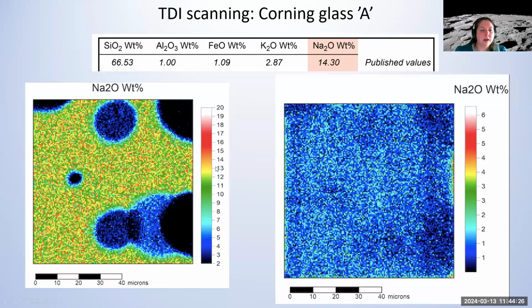And again, just to show, if I look at the last map for sodium, the last one here on the right-hand side, compared to what I get with the TDI scanning, this is after half a second of mapping that each pixel experienced. And you can see that almost all of the sodium is gone, and the previous spots seem to show a baseline of how low the sodium goes. So again, very, very powerful in the mapping mode.